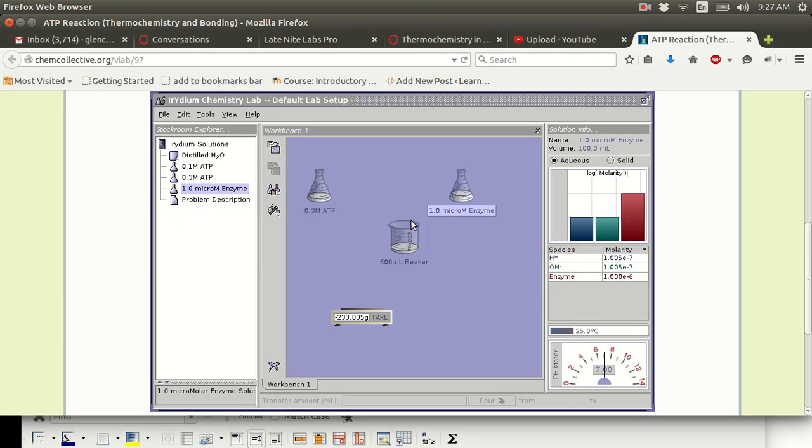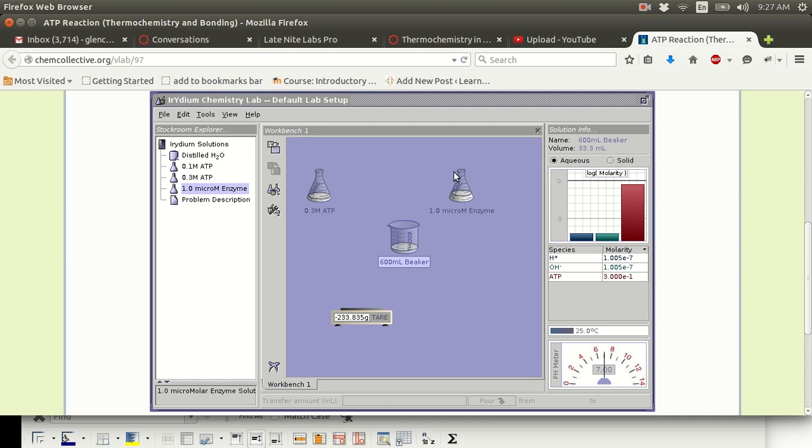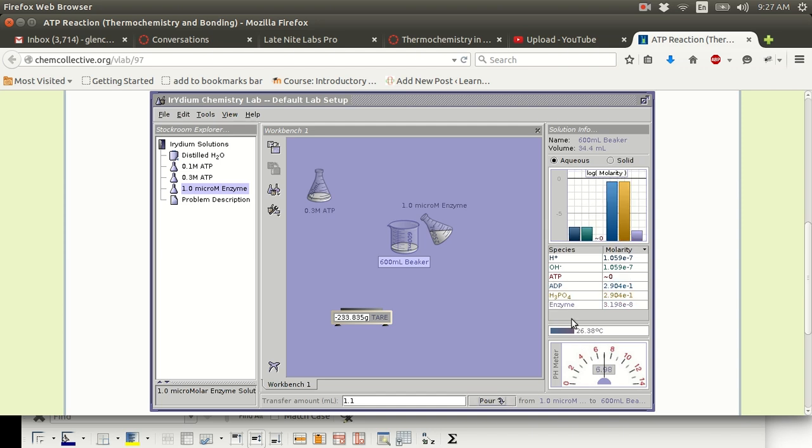What was the temperature? Let me just check that. It's 25.0 degrees Celsius. And I'm going to add some enzyme solution. Now, when I add the enzyme solution, I'm going to watch this temperature. Okay, watch that. I'm just going to add 1.1 milliliters. Watch that temperature. Watch that. 26.45. Did you see that?